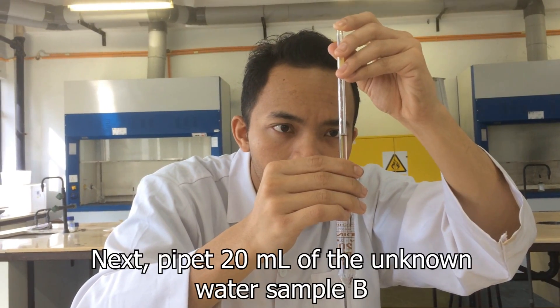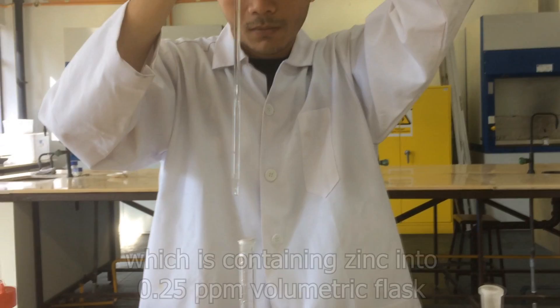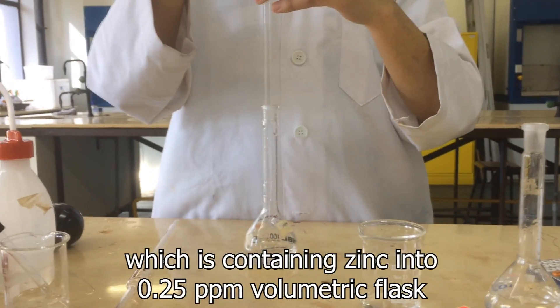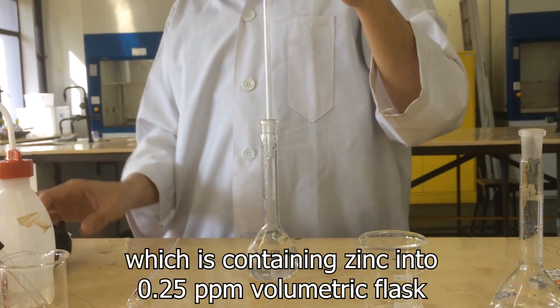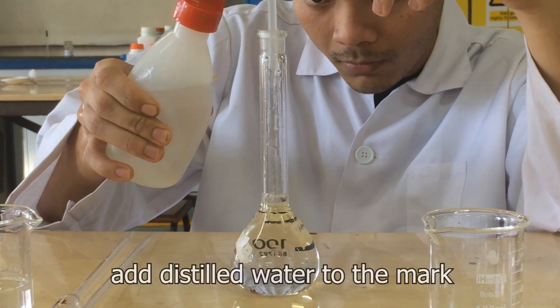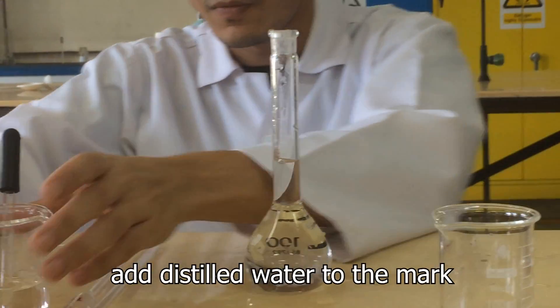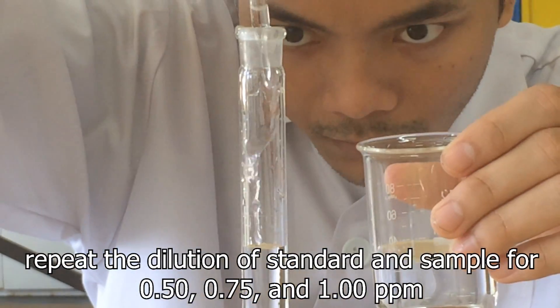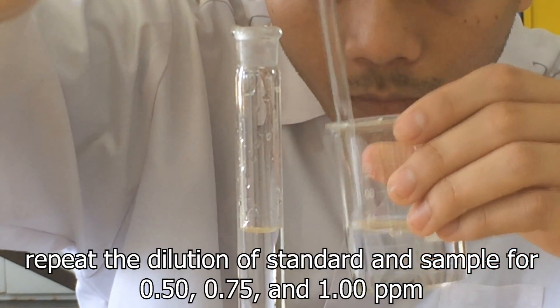Next, pipet 20ml of the unknown water sample B which contains zinc into the 0.25 ppm volumetric flask. Add distilled water to the mark. Repeat the dilution of standard and sample for 0.5, 0.75, and 1 ppm.